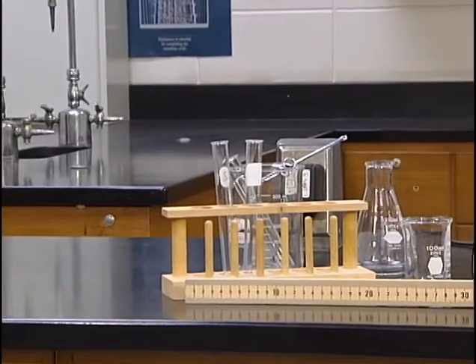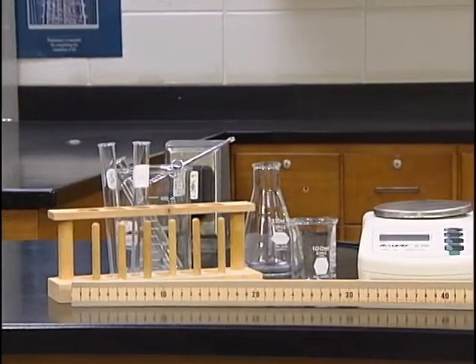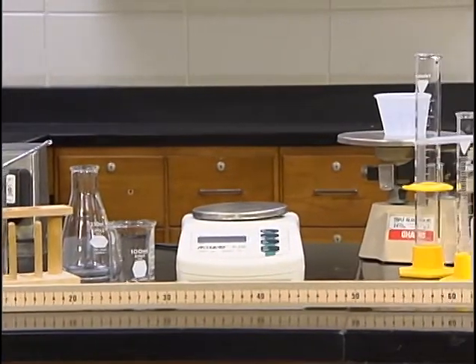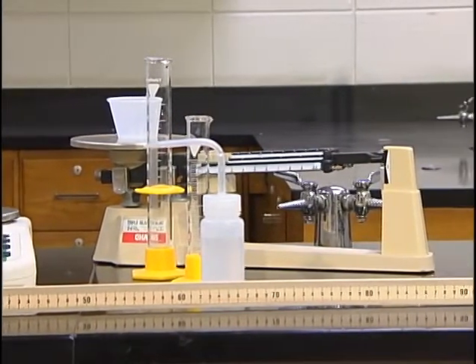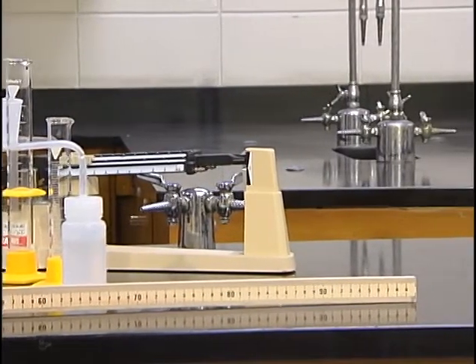Look around our laboratory. We will be using all kinds of equipment this year as we learn chemistry together. We will use simple pieces of equipment, such as the meter stick, all the way to more advanced pieces of equipment, such as the digital balance. As we study chemistry together, we will need to know how to use our equipment correctly. After all, chemistry depends on accurate and precise measurements.